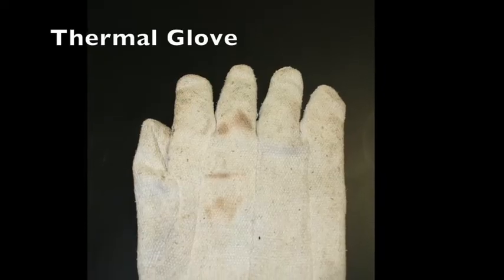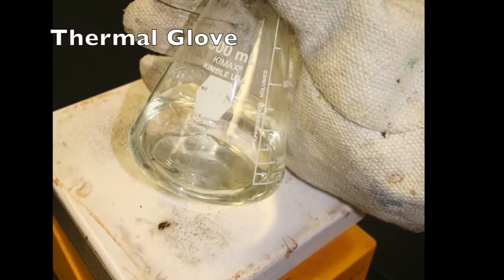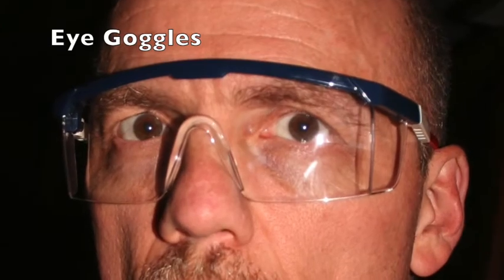The thermal glove is worn on the hand to allow heated objects to be picked up. Note that its insulation property is diminished when it becomes wet. Therefore, it is vitally important to keep the glove dry. Eye goggles are another safety device that should be worn anytime hazardous chemicals are being used, something is being heated or burned, sparks are possible, or any procedure is being conducted that could potentially harm the eyes.